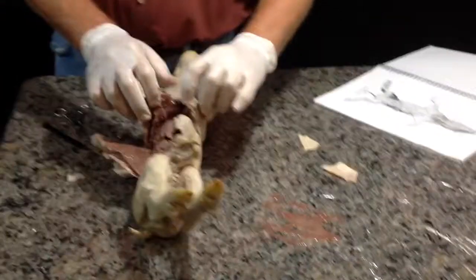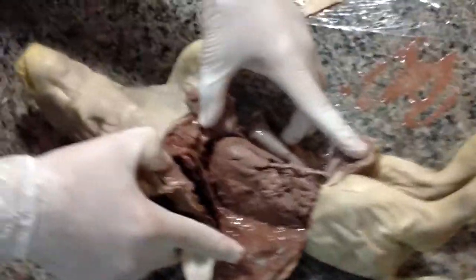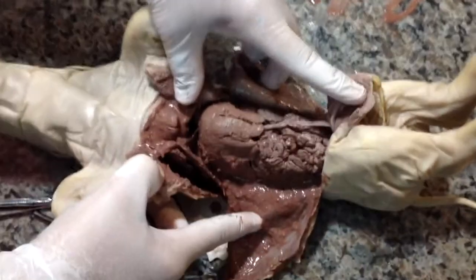So what we're going to do, now that we've got him cut open here, is show you one thing. I want to just show you how we've gotten into the inside. I want to show you everything's packed, and then we will come in and pick it up with video 2.